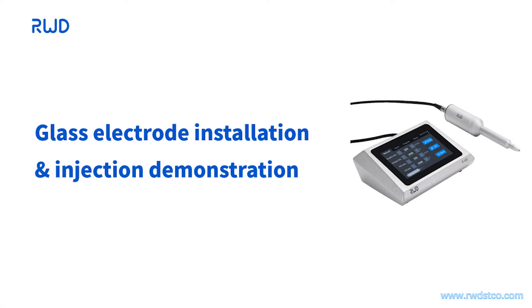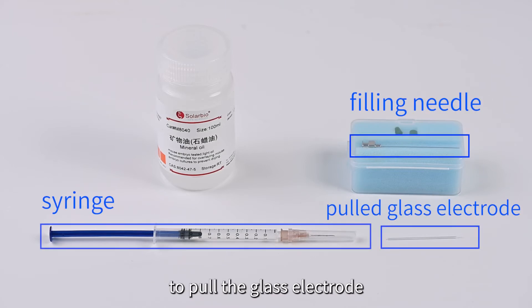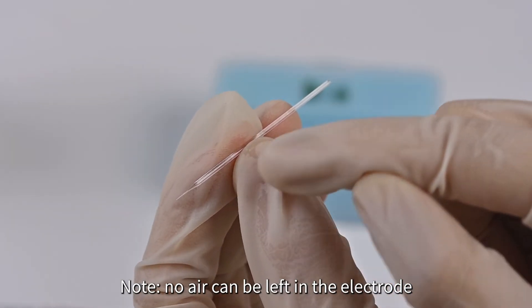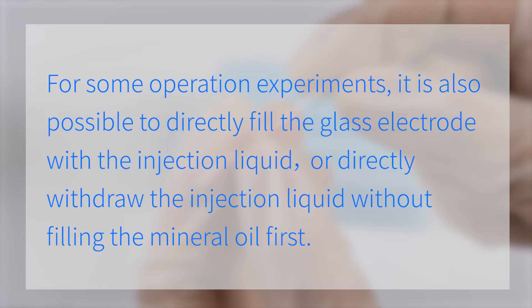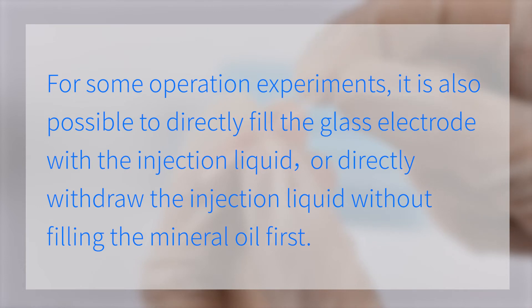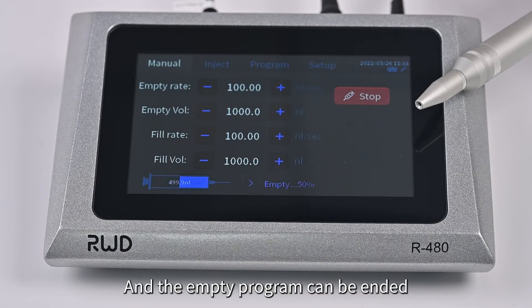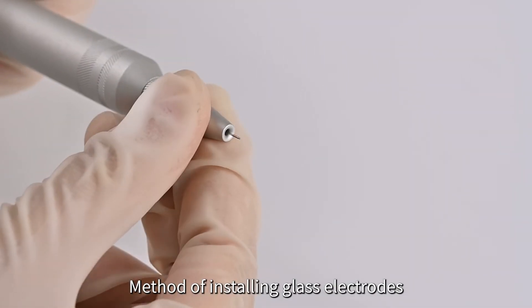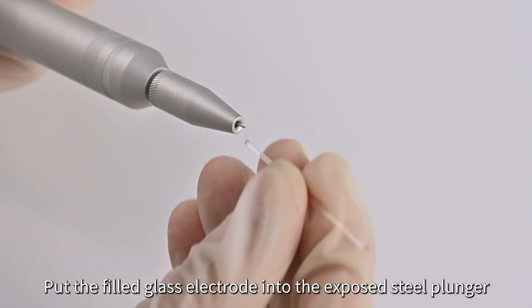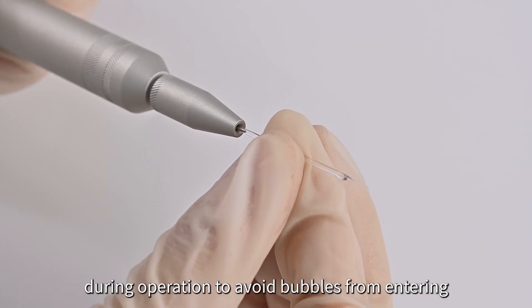Part 3: Glass electrode installation and injection demonstration. Before the experiment, use the micro pipette puller to pull the glass electrode. Backfill the pulled glass electrode with mineral oil using a filling needle. Note: no air can be left in the electrode. Click the Empty button on the manual interface of the control unit, and end the empty program when the steel plunger is exposed. To install the glass electrode: loosen the collet slightly, put the filled glass electrode onto the exposed steel plunger, and slowly insert it to the bottom. Be careful to move gently and slowly to avoid bubbles from entering.